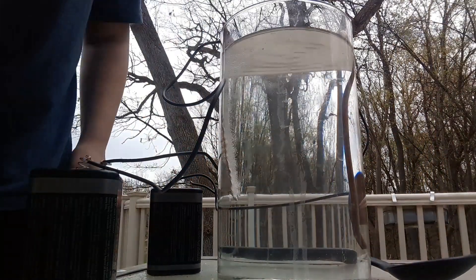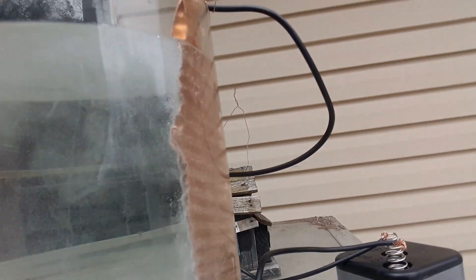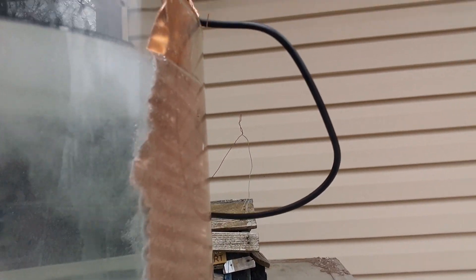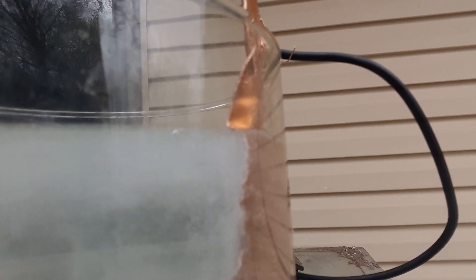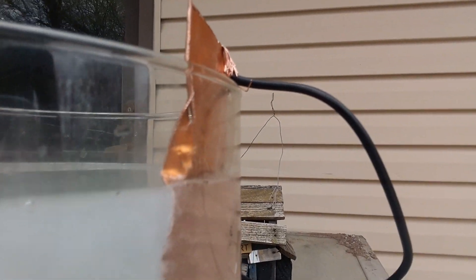And as you can see it's bubbling. Hydrogen gas is being produced at the end that's obviously bubbling the closest, and it should be making copper oxide.